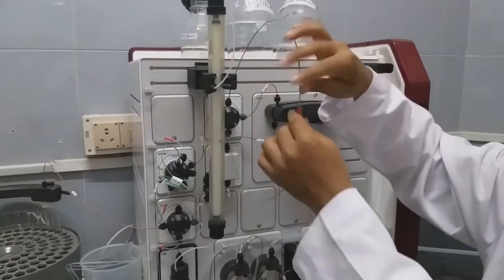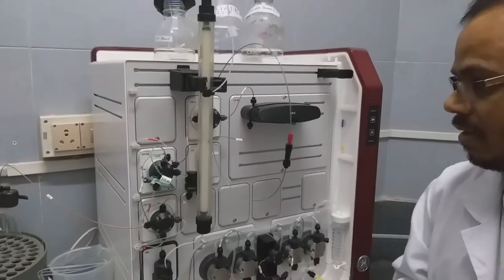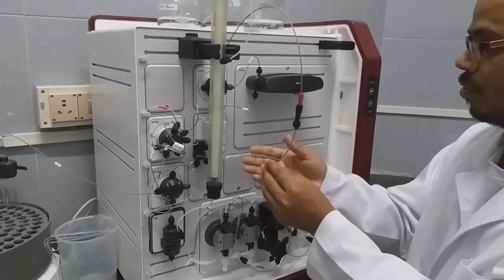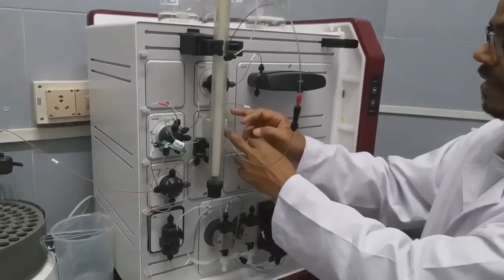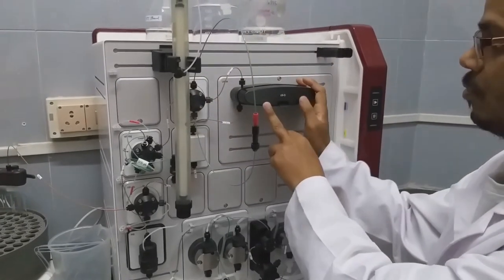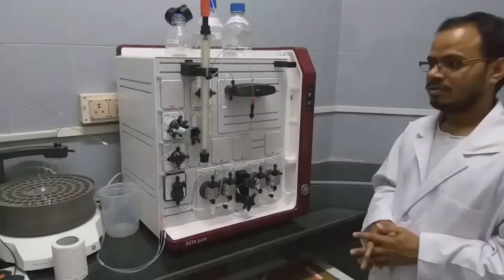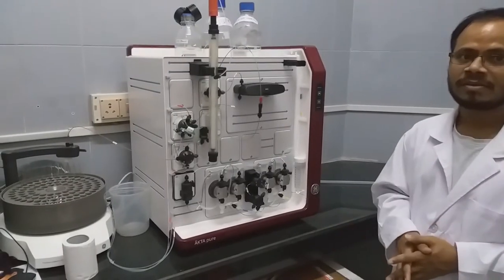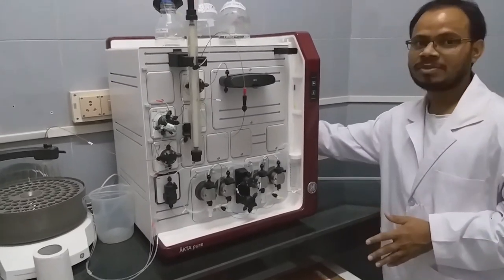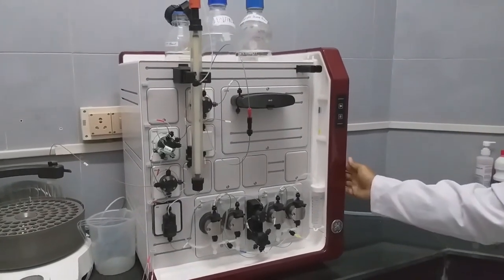The top portion of the column connects here — we will show you how to connect the column in the coming steps. After passing through the column, whatever comes out will enter the UV chamber where the eluted components will be detected. To start the instrument, there is a power button on the right side. You have to turn on the instrument, and you will see a white light blinking here, which means the system has just started.